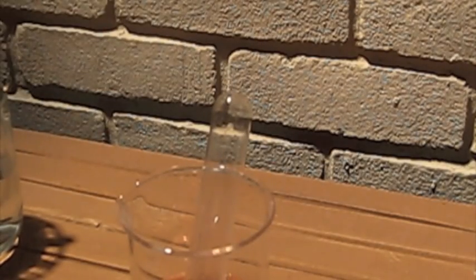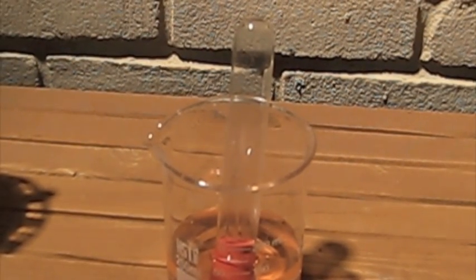I'm pushing in the stopper a little harder. Watch this - there's going to be a fountain. It's pretty cool. Get ready, this is pretty energetic.